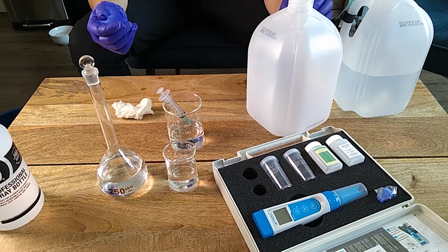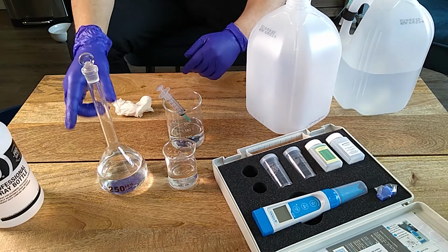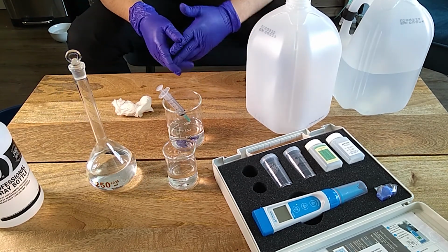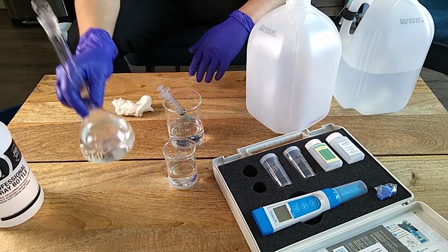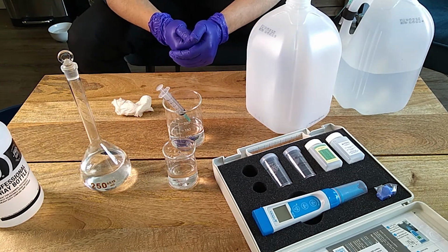Now, one thing that is important is that if you're going to use a water source that is not distilled water, prepare the dilution with whatever water source you're going to be using. So if you're going to be using tap water, then make this dilution with tap water because we need to account for that within the conductivity measurement.